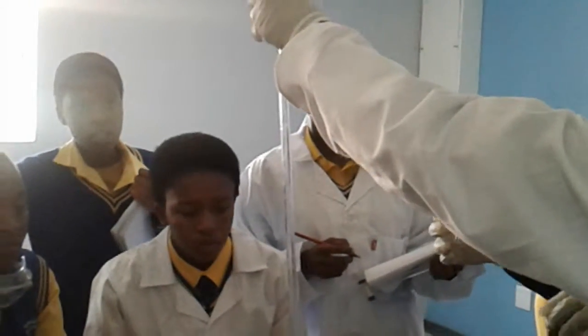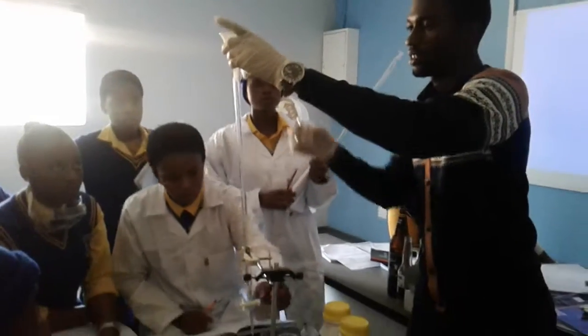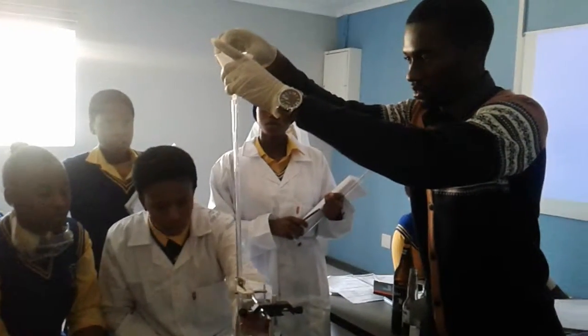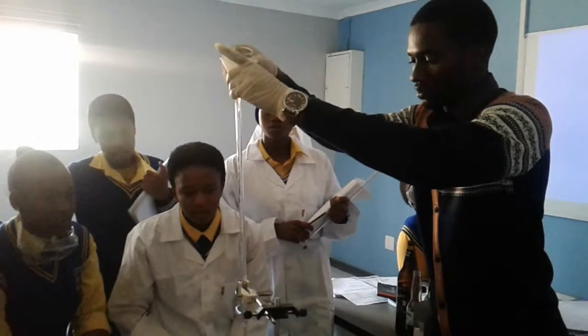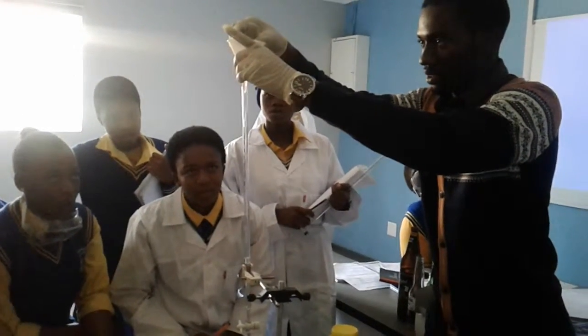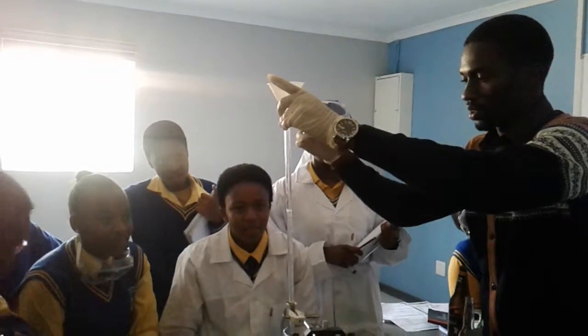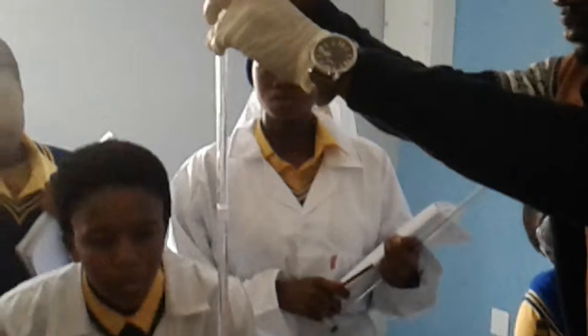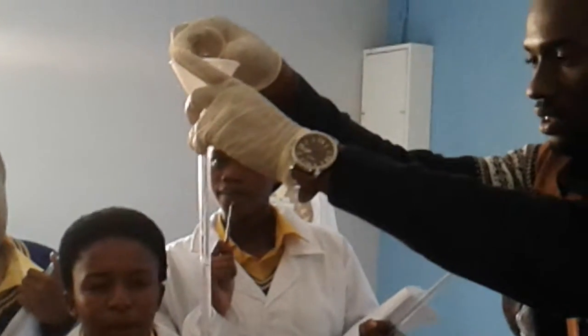Where's the other funnel? We don't want to mix them. Here. Is it at 0 yet?